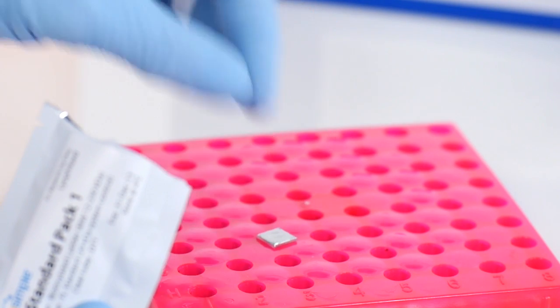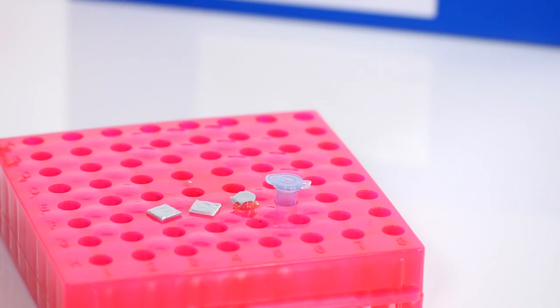To make it even simpler, we've color-coded the tubes. For now, you can place them in the tube rack.